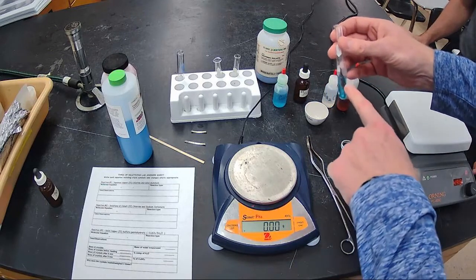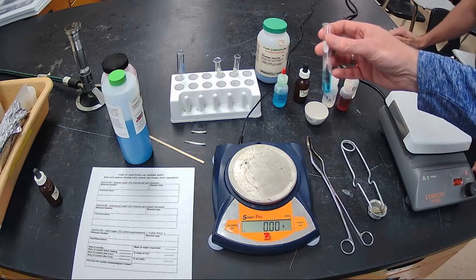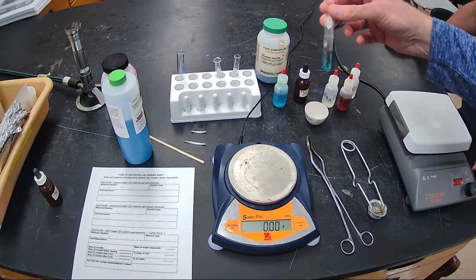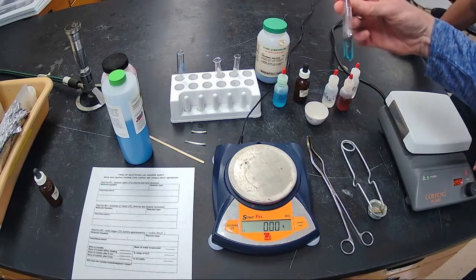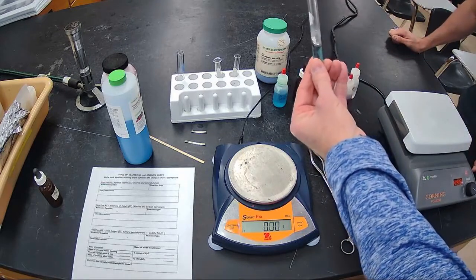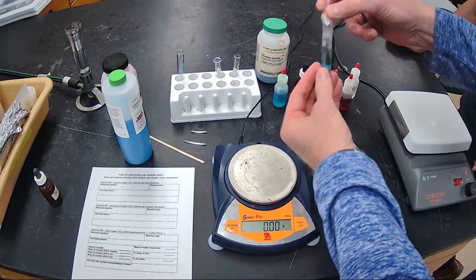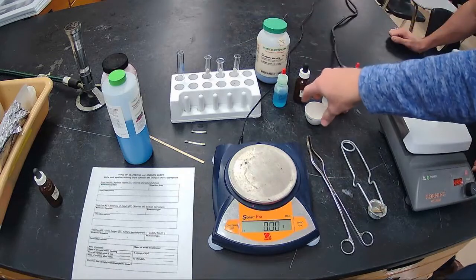So we can see the bubbles on the outside of this aluminum foil, but we also see some weird color change happening. It's a reddish brown substance. When you shake it, you can get it to shake off of the aluminum foil and settle on the bottom. What do you think that is, Mr. Furiosi? We'll let them figure that out maybe with their reaction, right? Yep. There's only a few things that I can imagine that could make that kind of color. So a nice reddish brown solid that's forming on the outside of this and shaking it off. We can let this run and revisit it at the end. We'll set that there.